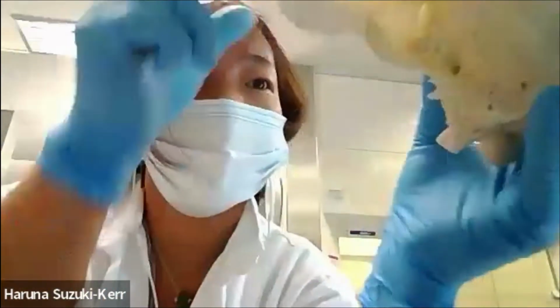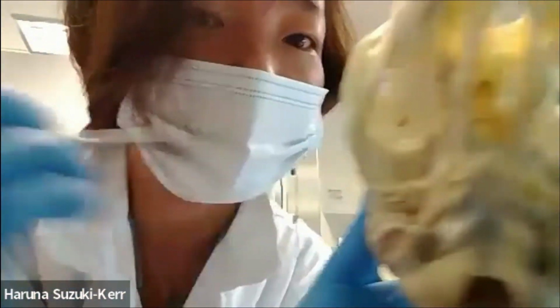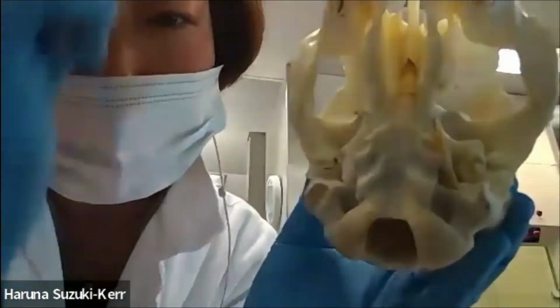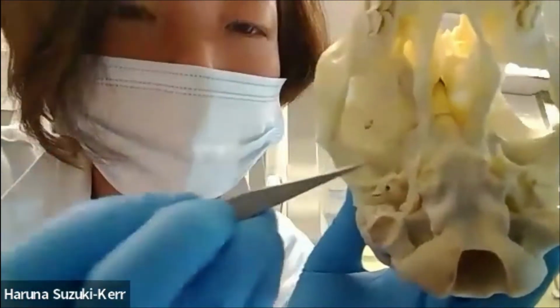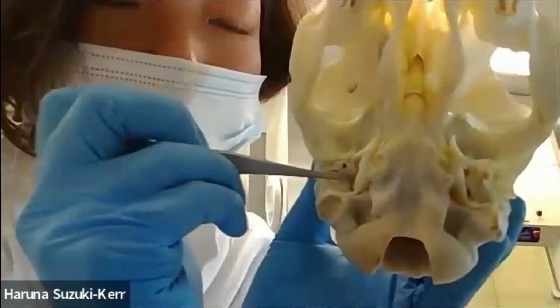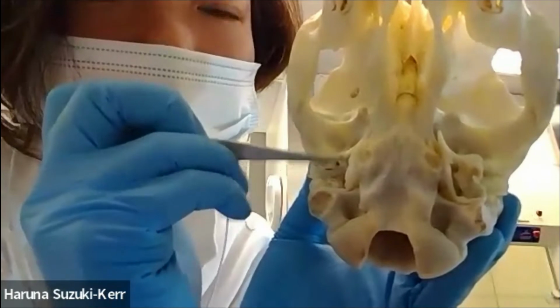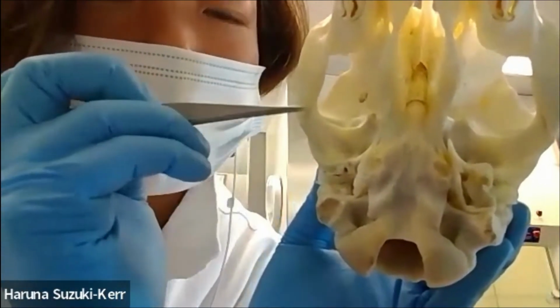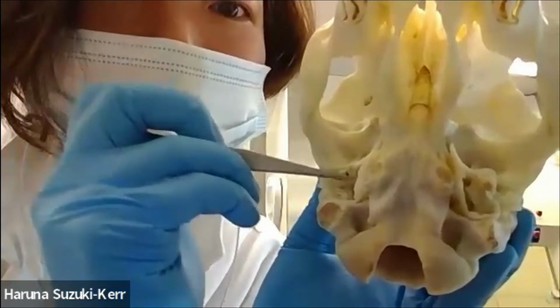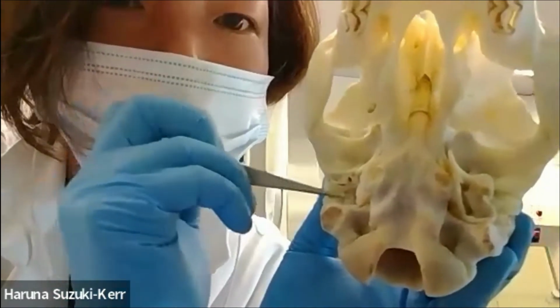So if we turn it around, as we can do here, we have this structure called the otic bulla, and I'll show you the zoomed up version over there. But essentially, we have the ear canal going down this way, and about the tip of where my forceps is, is where the cochlea is. One thing to highlight here is that it's actually right underneath the skull, and it's only a few centimeters inwards from the end of the ear canal for sheep.